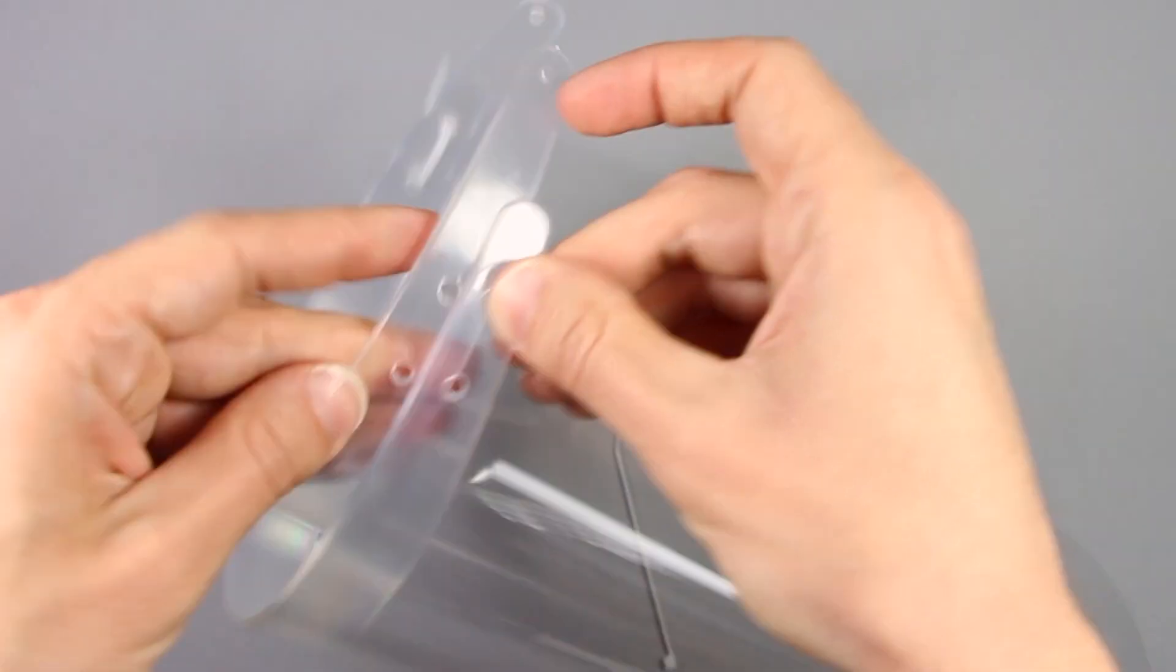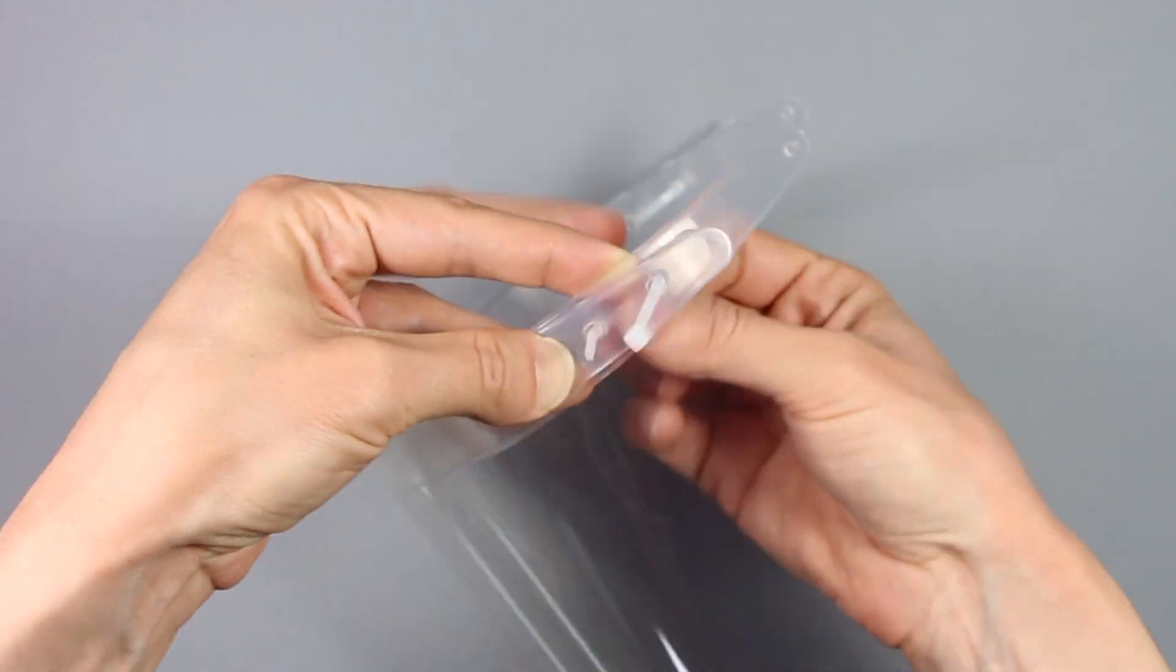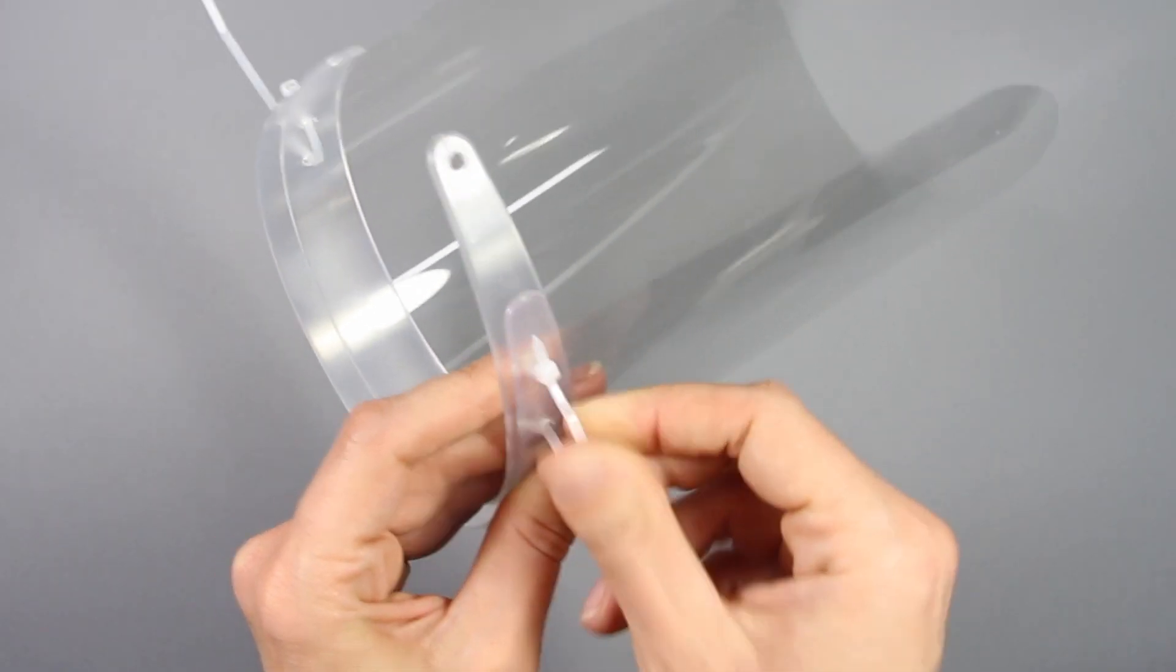Guide the plastic around the headband and repeat on the other side. With everything in place, close both zip ties.